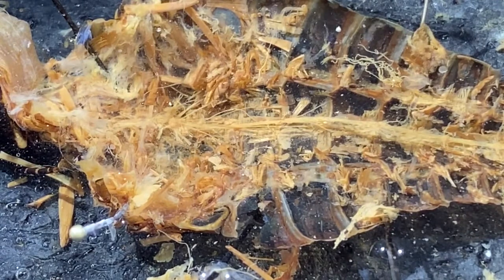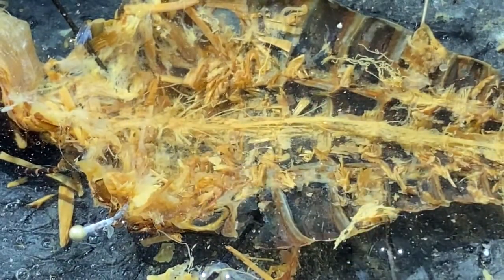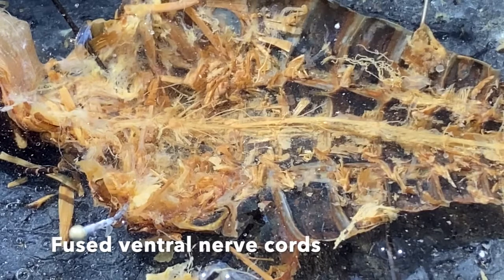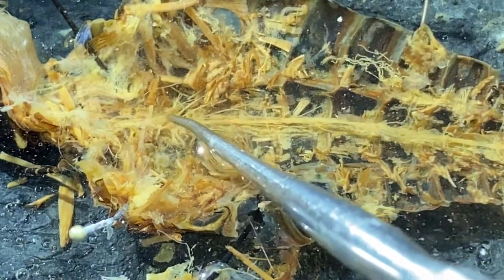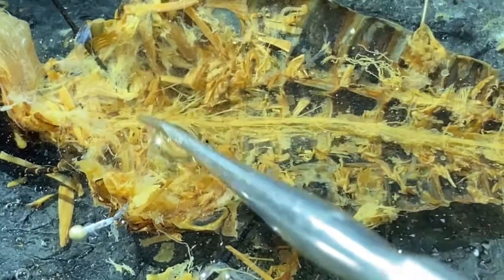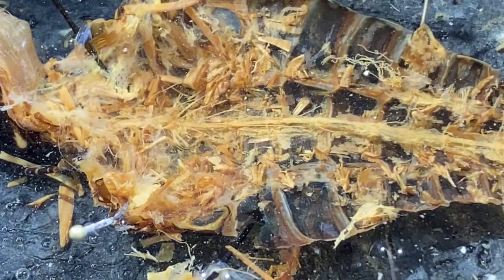Then there are connectives that come around either side of the gut, and then they give rise to the ventral nerve cord. Now this ventral nerve cord is actually a fused nerve cord. There are two nerve cords that are fused together, and you can see a variety of structures in here. For example, right here, this structure is a large ganglion with many neural processes coming off in this region of the body. This is the thoracic region. It's likely that this large ganglion is going to be innervating and controlling muscles associated with the legs.